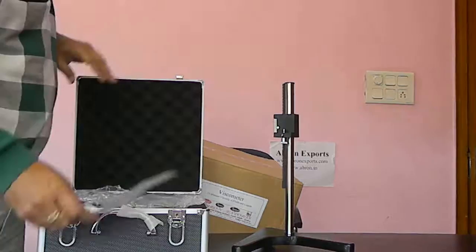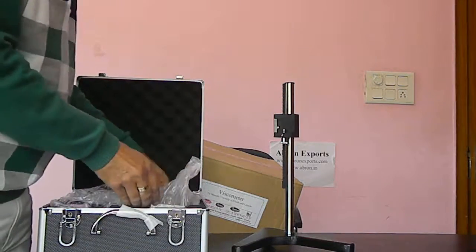And then there are viscometer parts. Take it out from the box.